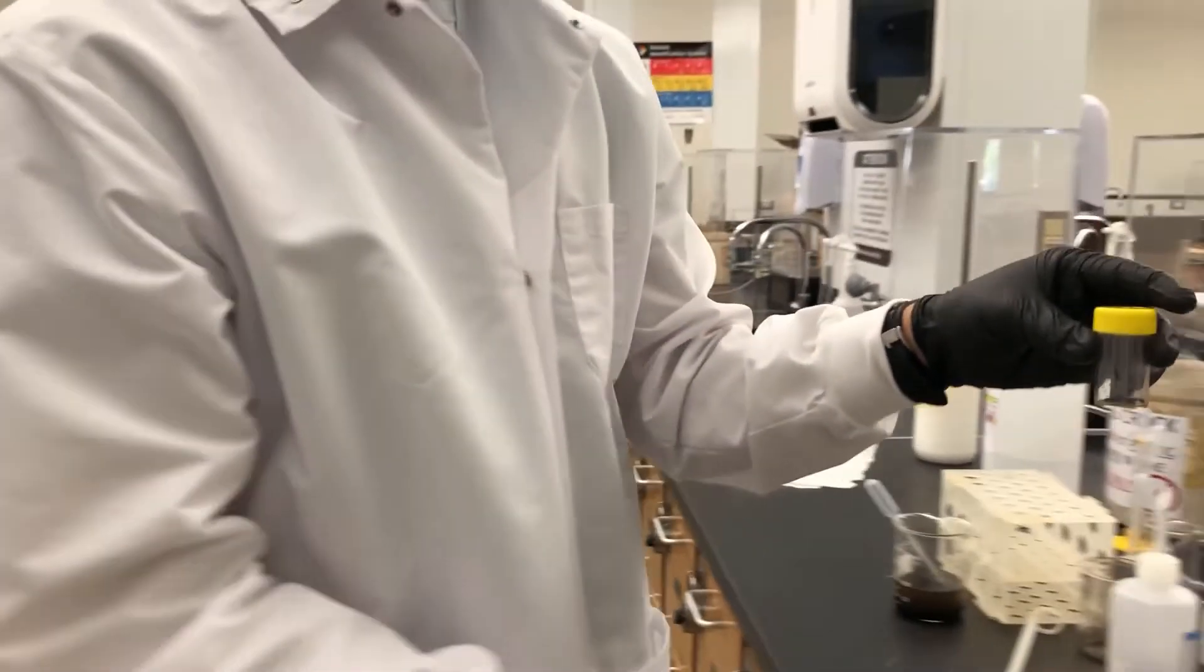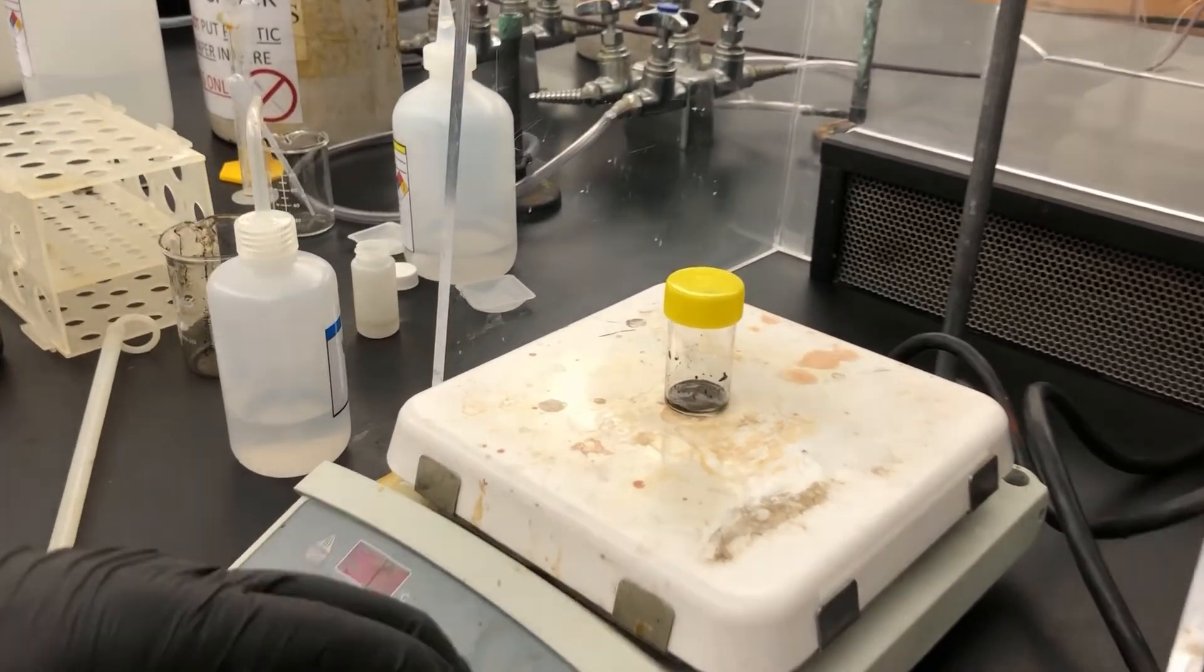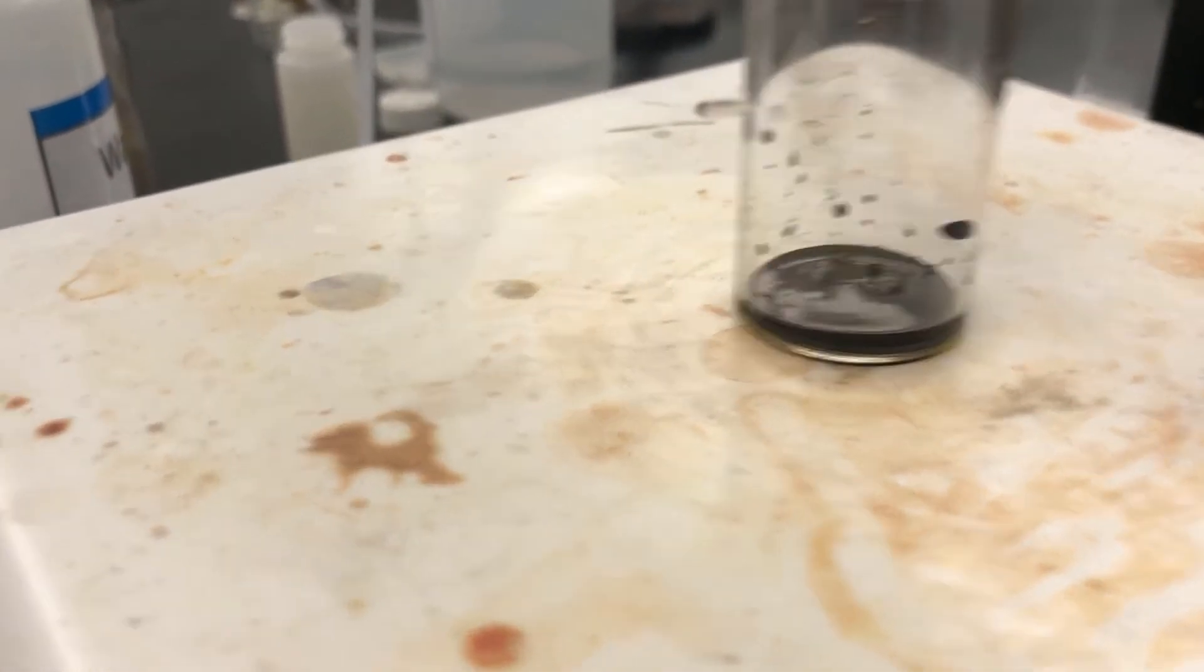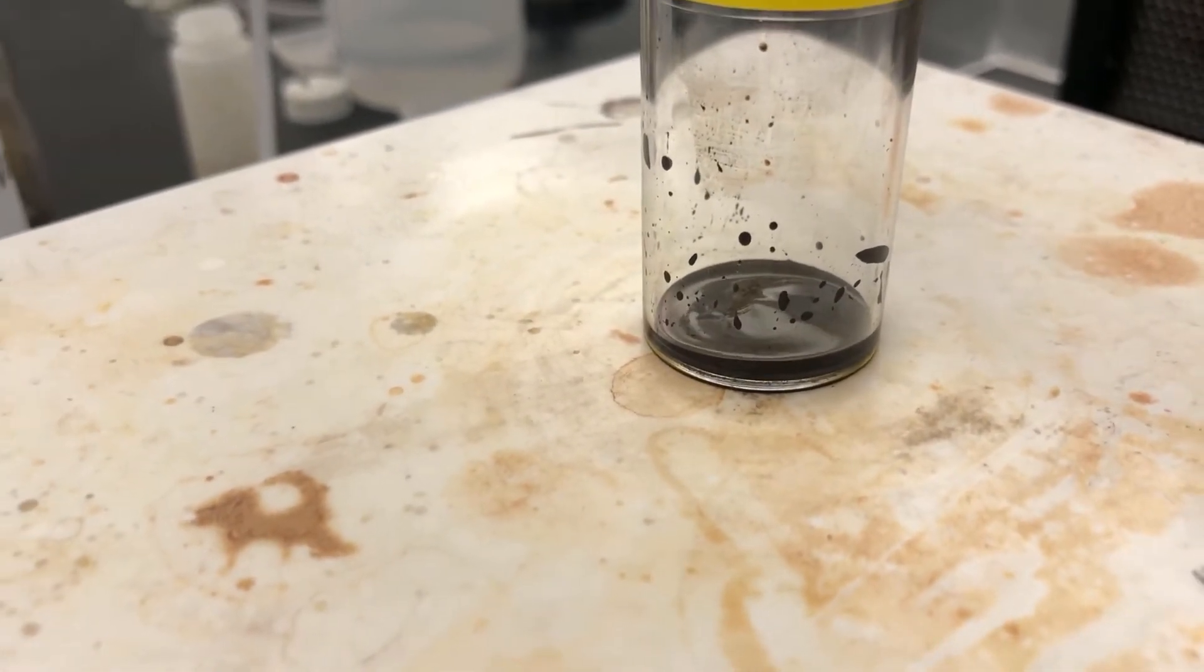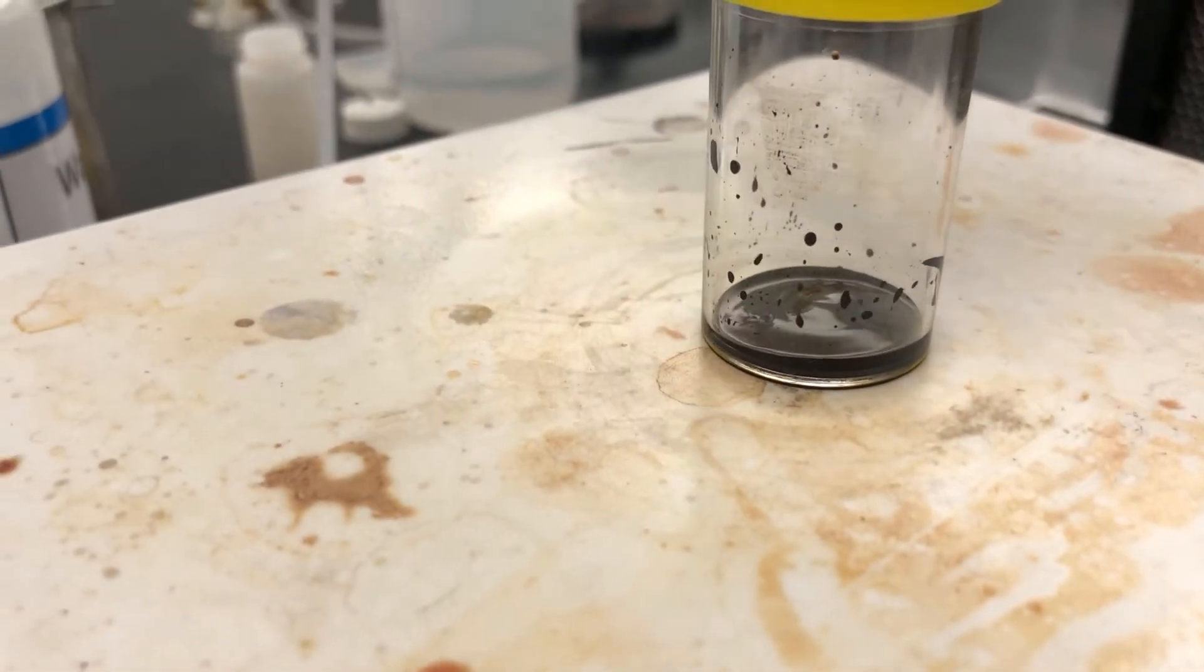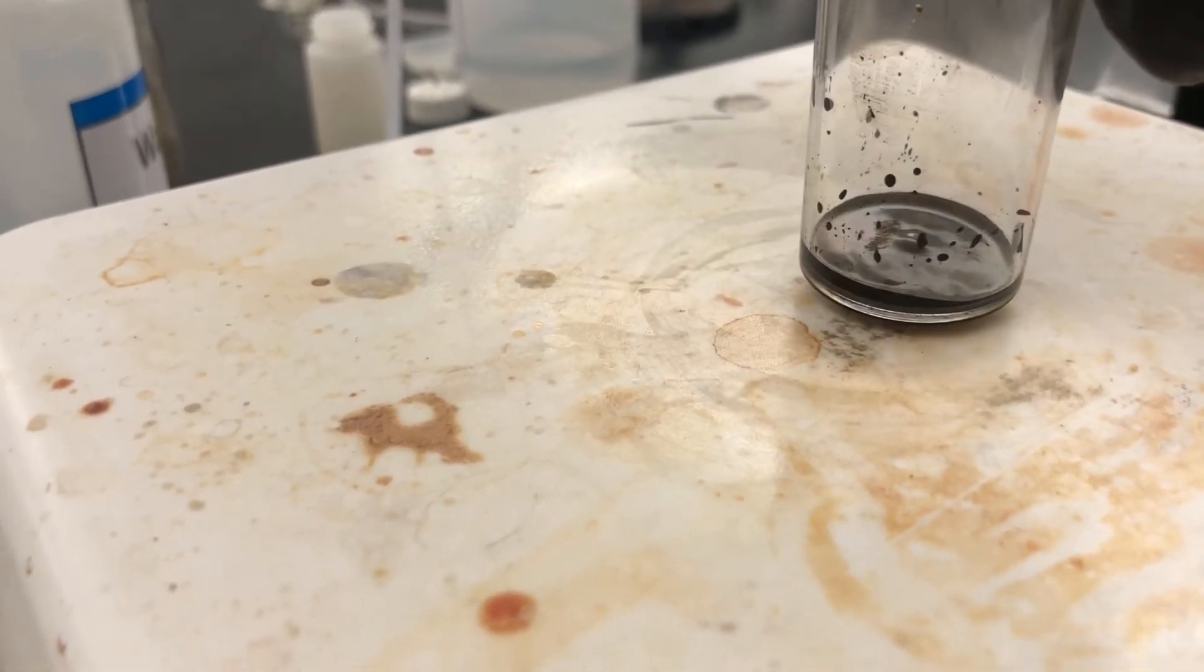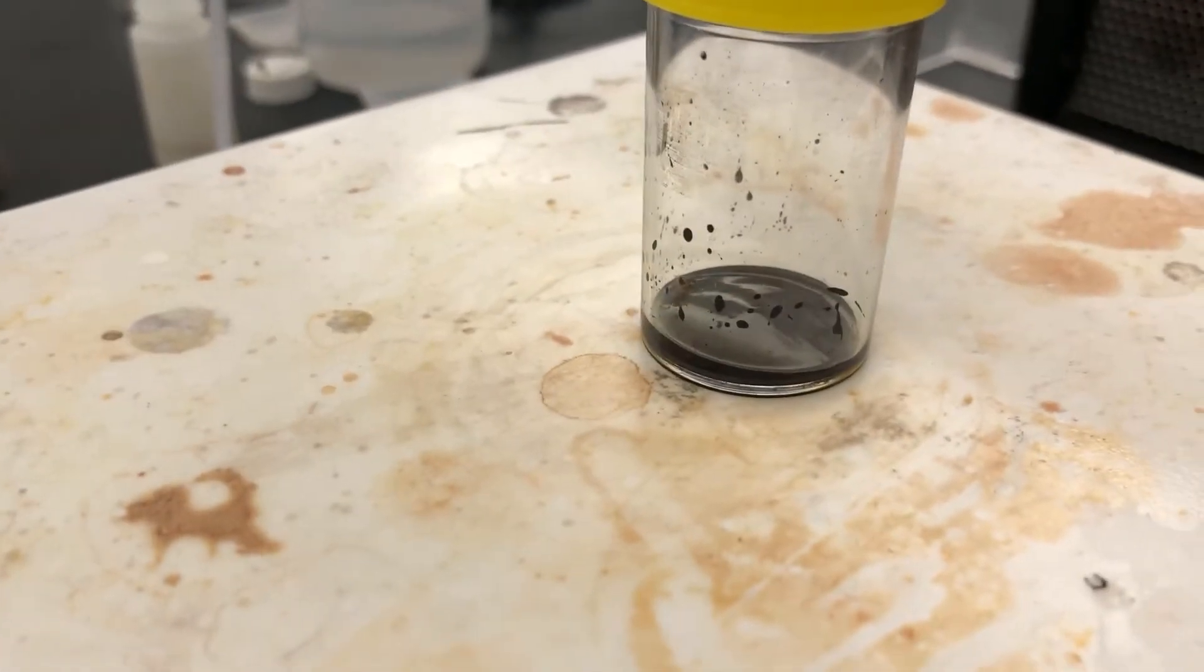Okay. Perfect. Another one has to put it on the stir plate here. So we'll do that. We'll turn it on and see what happens.